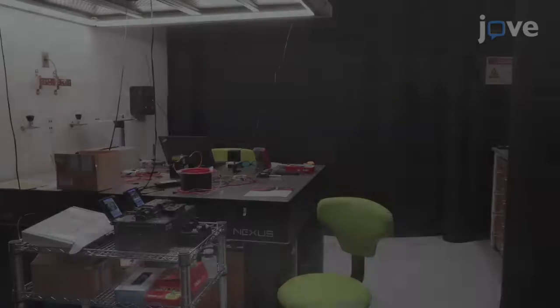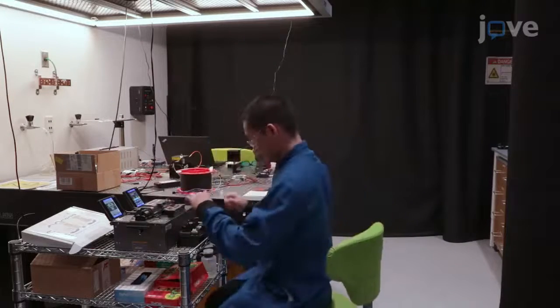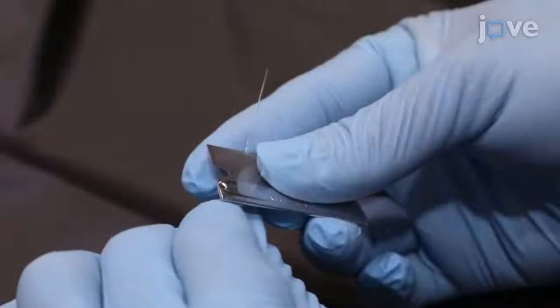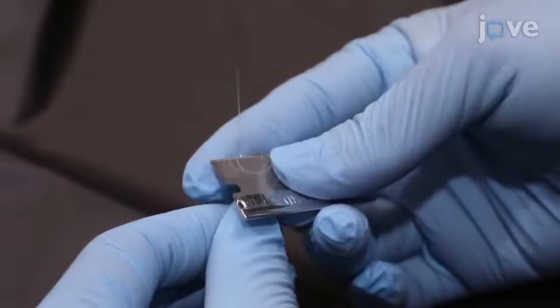Start by splicing single-mode fibers, or SMFs, in order to ensure proper performance of the splicing equipment before more valuable fiber optic materials are used. Strip approximately 30 mm of the fiber with a fiber stripping tool. If working with fragile fibers, a razor blade can be used to carefully peel off the buffer.